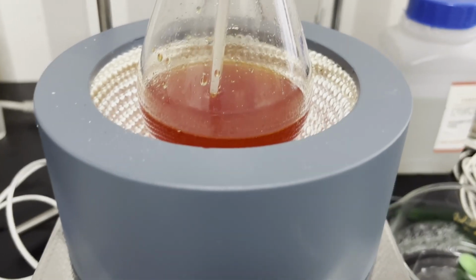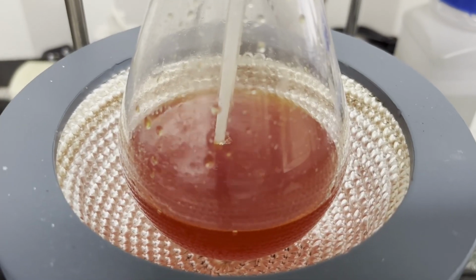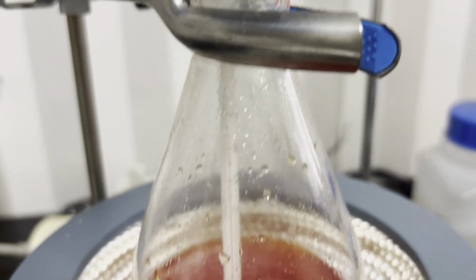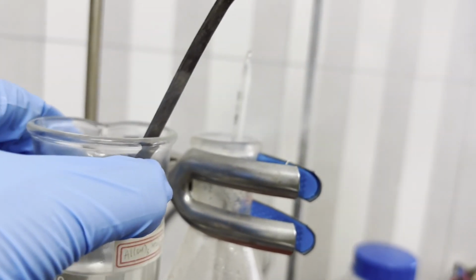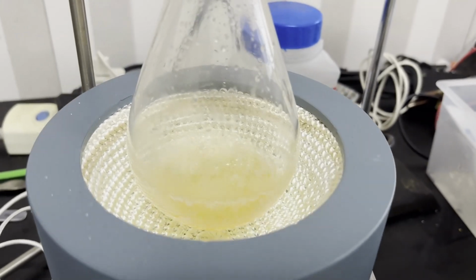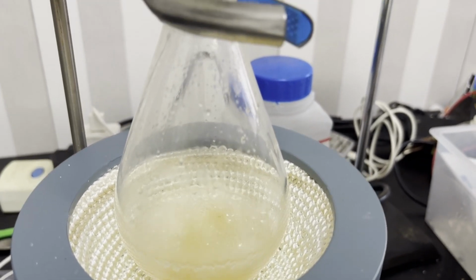When the red color doesn't appear to fade away, I decided to stop adding bromine and remove the ice bath. I then lightly heat the flask to expel the hydrogen bromide and bromine, and also force the reaction to completion. As the mixture boils, a copious amount of hydrogen bromide is released, and the color of the solution slowly got lighter, eventually turning to a light yellow. The remaining DCM is then quickly distilled over.